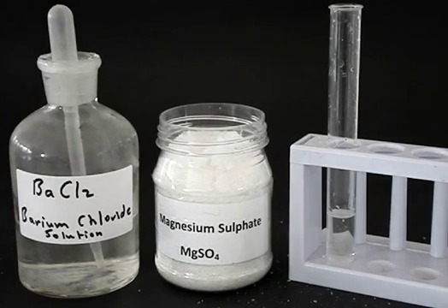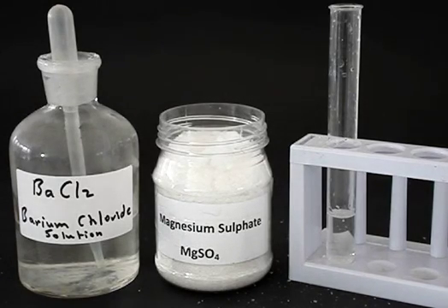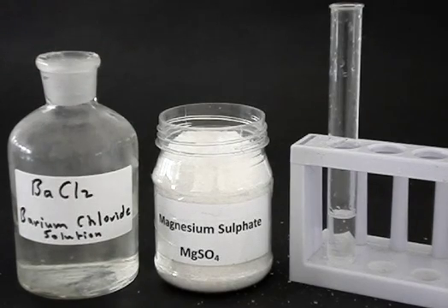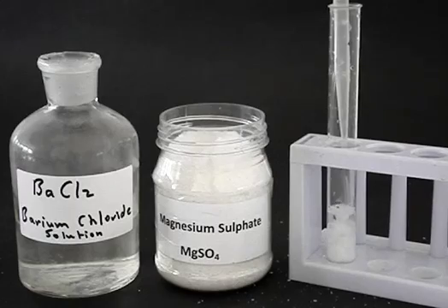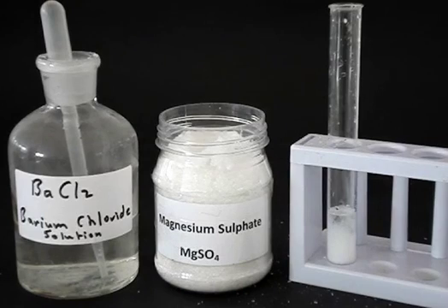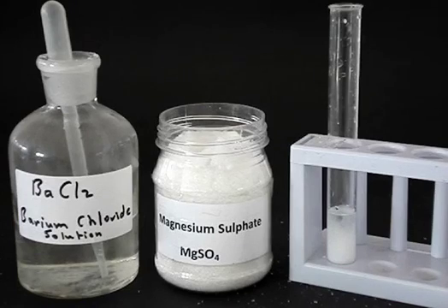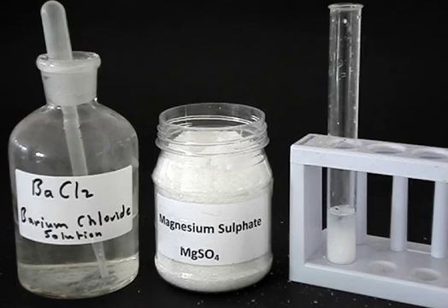We hypothesize it might be a sulfate, so we do the test for a sulfate. In the test for a sulfate, we add a bit of barium chloride solution. Barium chloride solution contains barium ions — Ba²⁺ ions — and Cl⁻ ions. The barium ions bump into any sulfate ions that might be present and form an insoluble combination: barium sulfate.